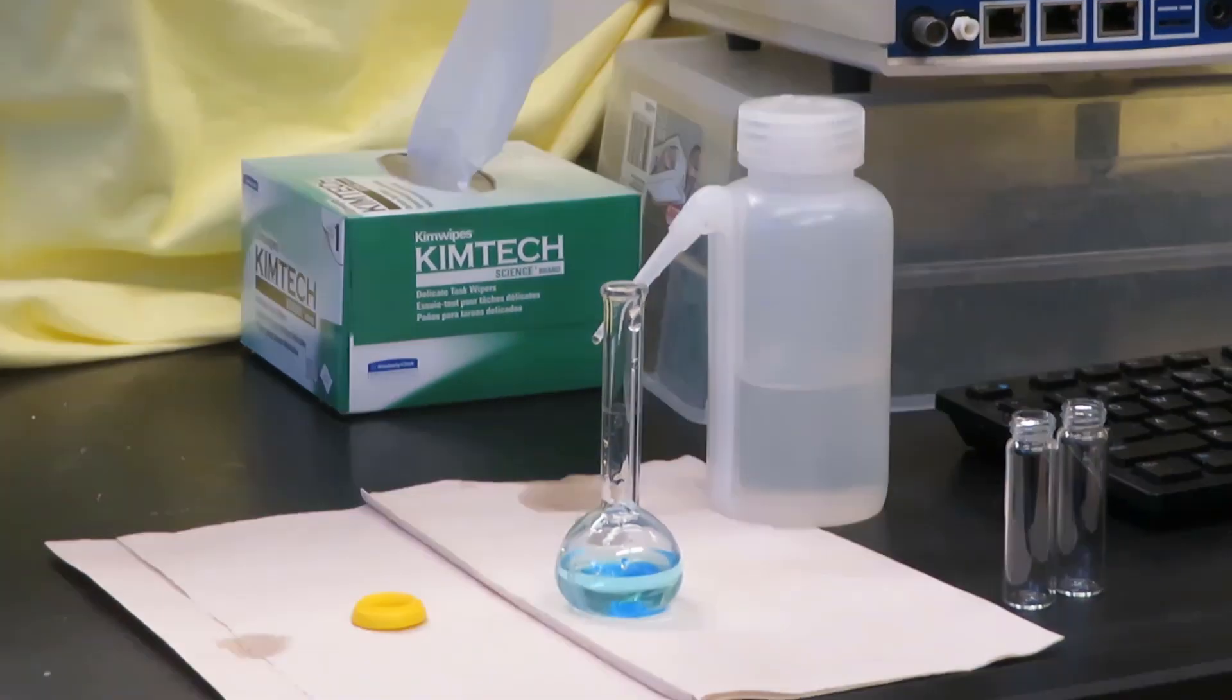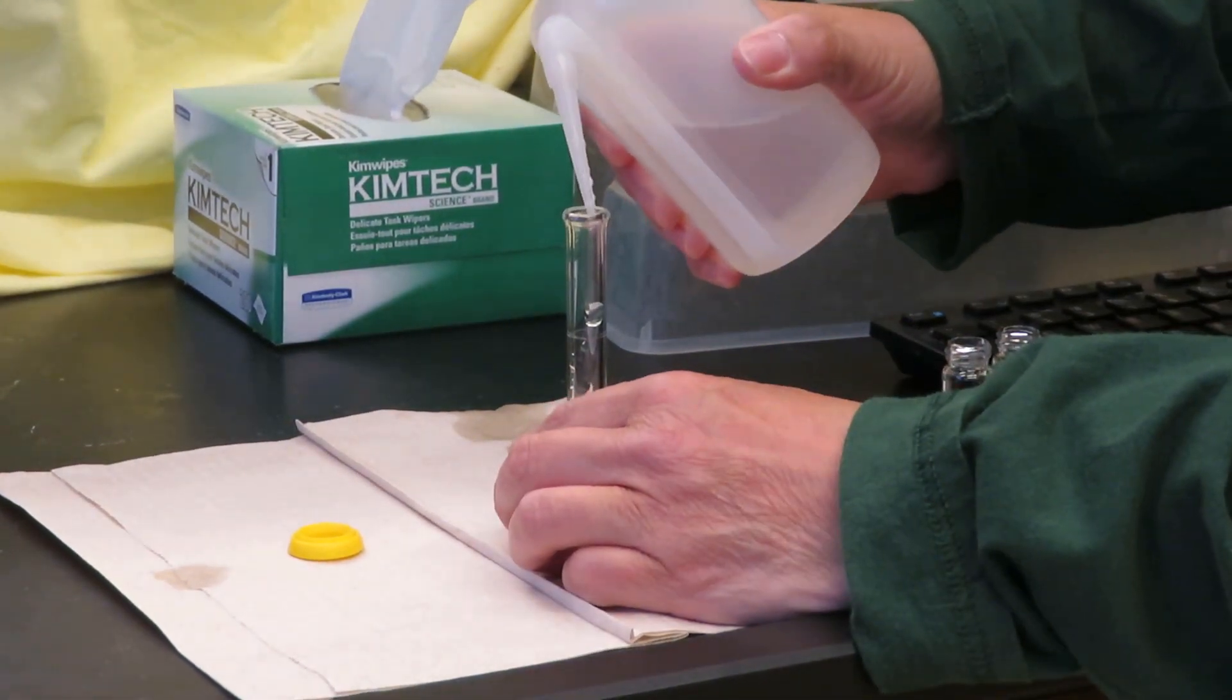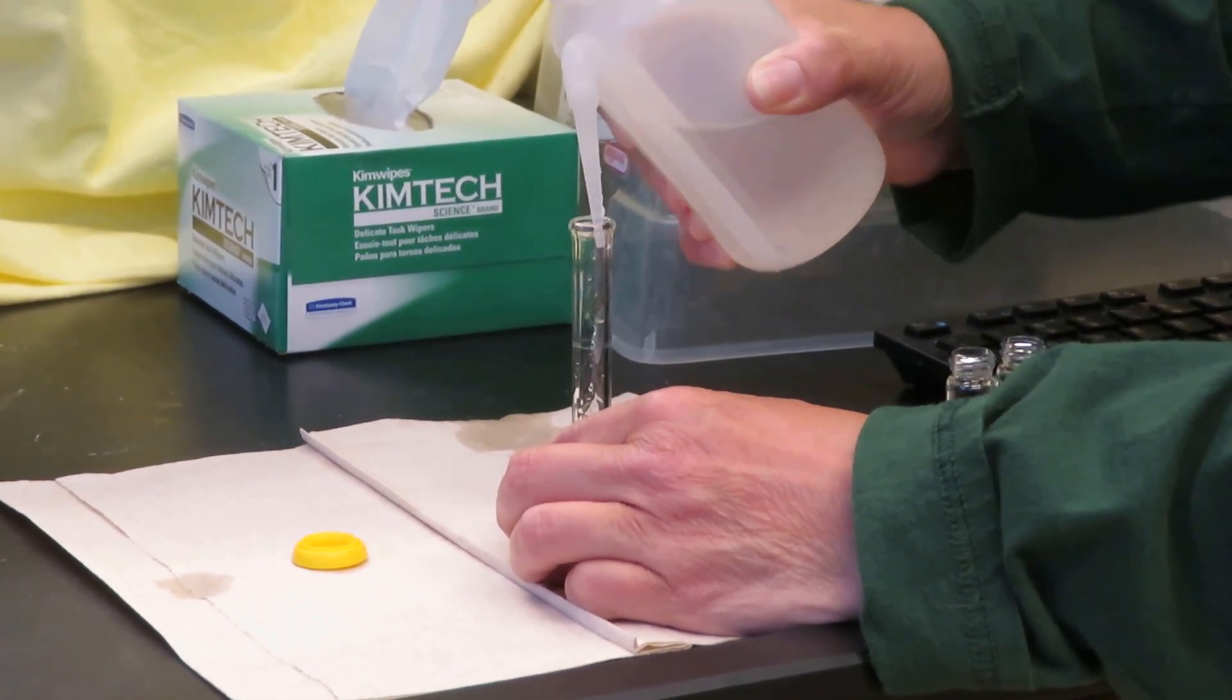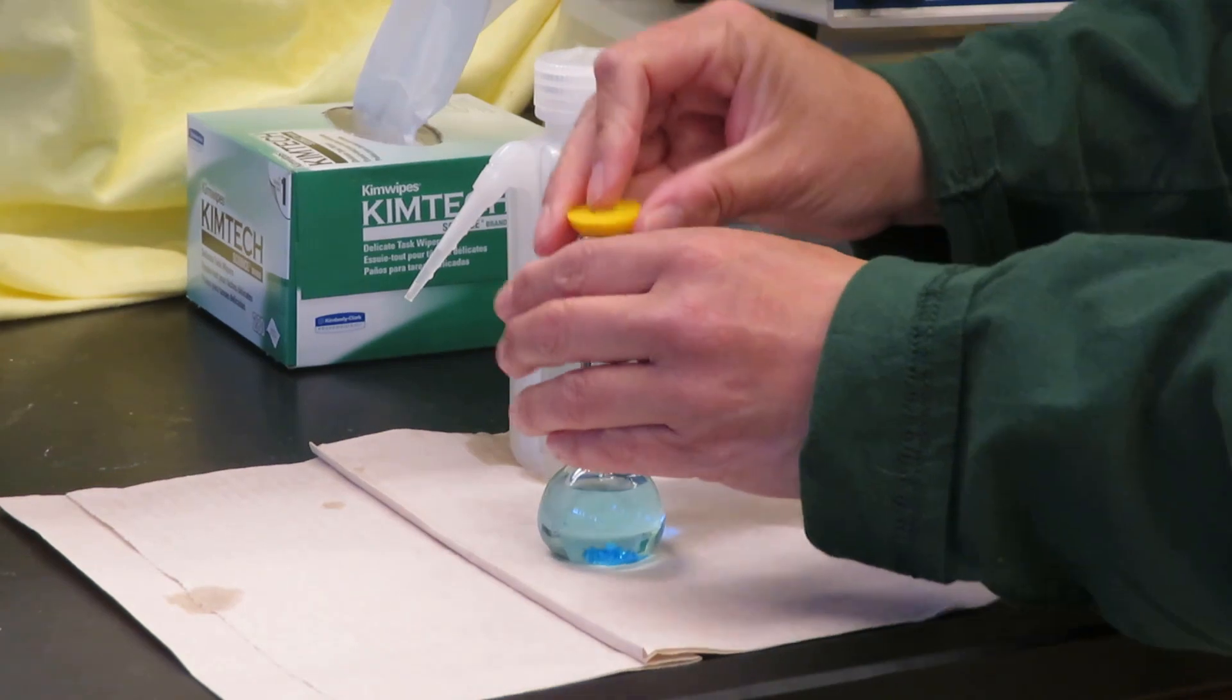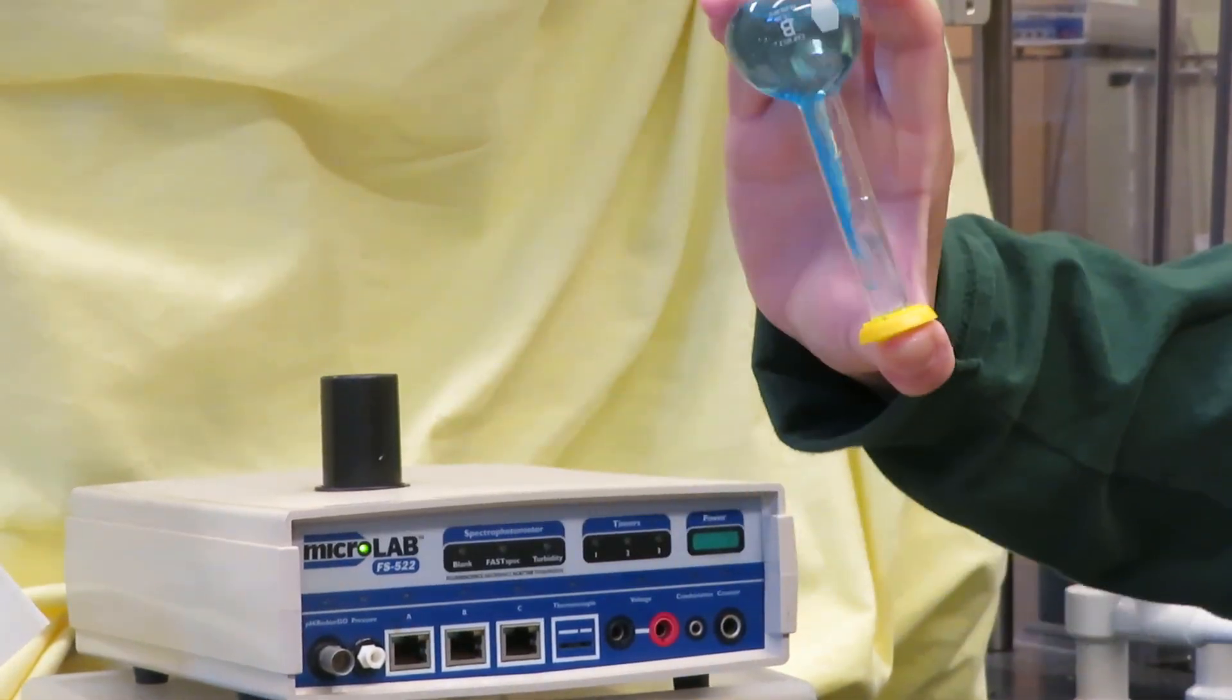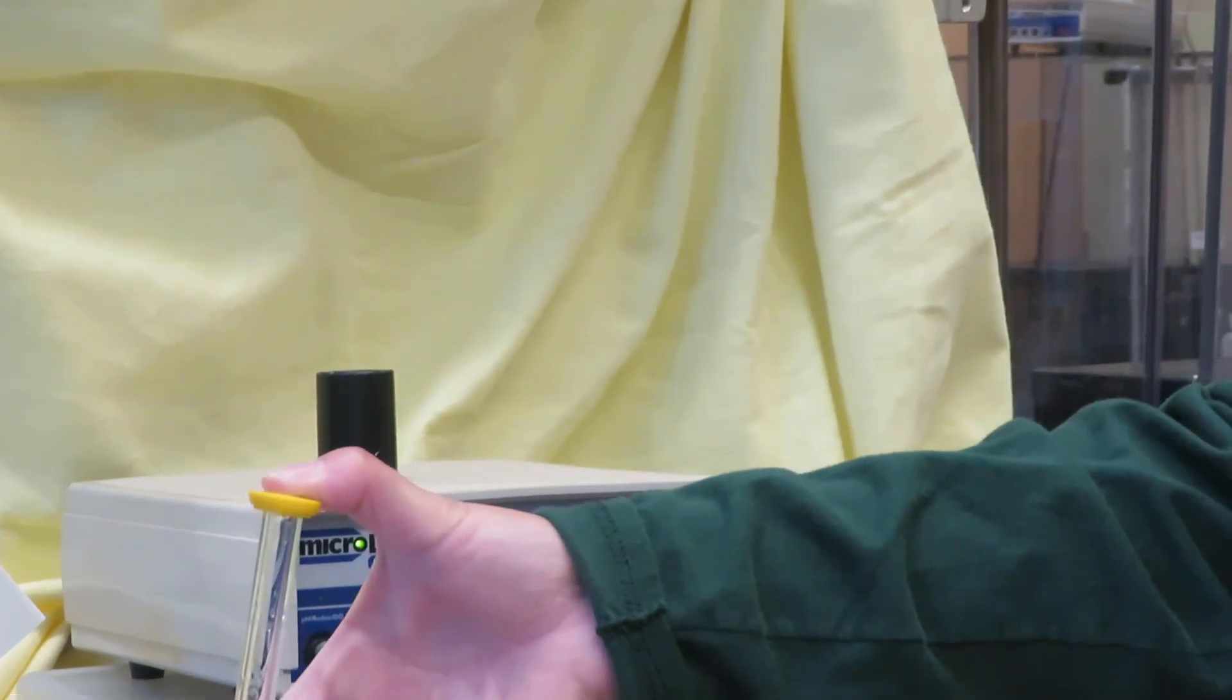Now I need to add water up to the line. I'm going to stop before I get to the line to mix it. I'll cap it and mix it. It'll take a little while for the copper sulfate to dissolve.